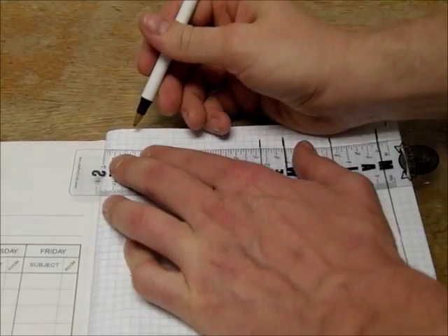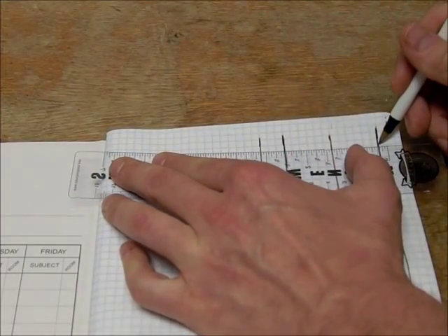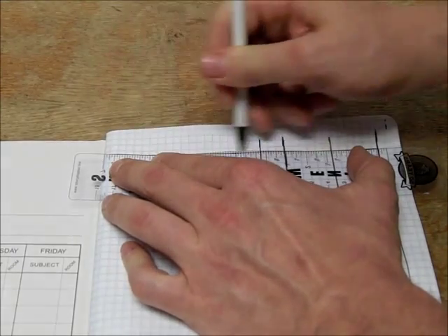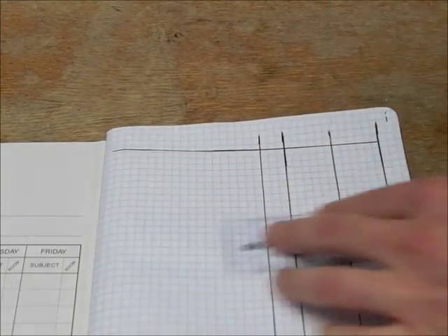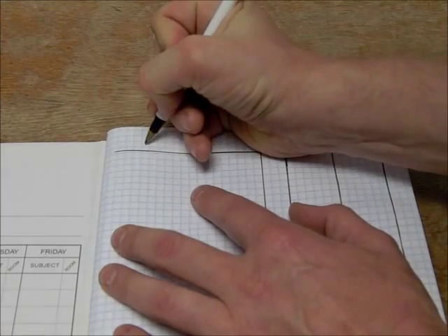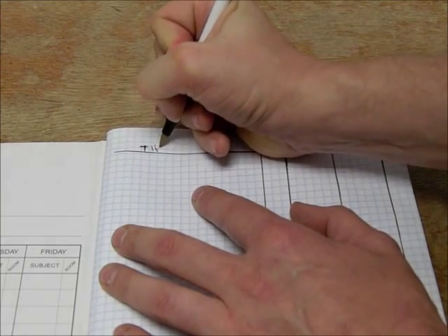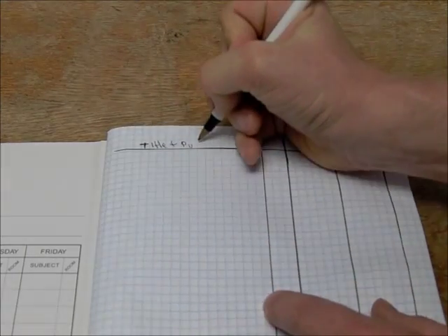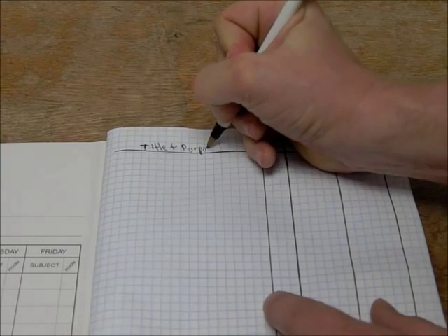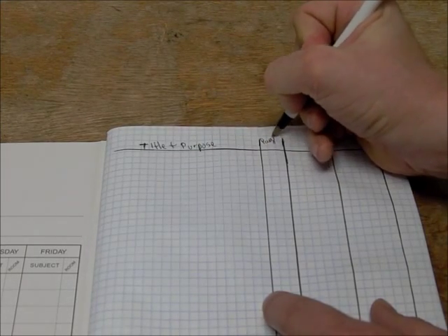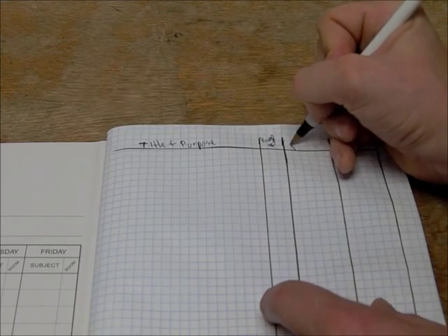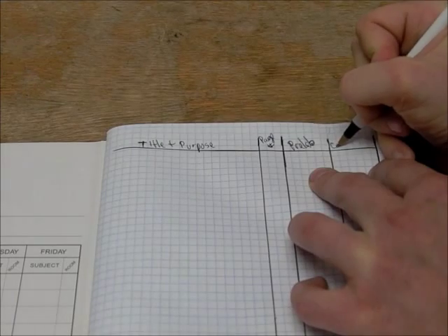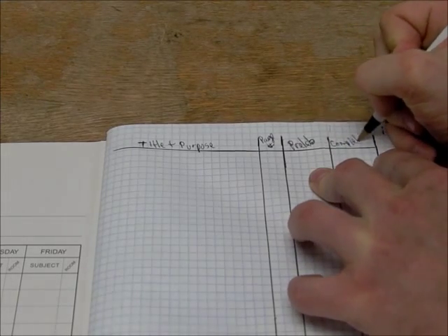I'm going to draw a line horizontally across the top, giving me about three, maybe four squares at the top of the page so I can still write something on top. At the top, I'm going to write down title and purpose, page number, prelab, and completion.